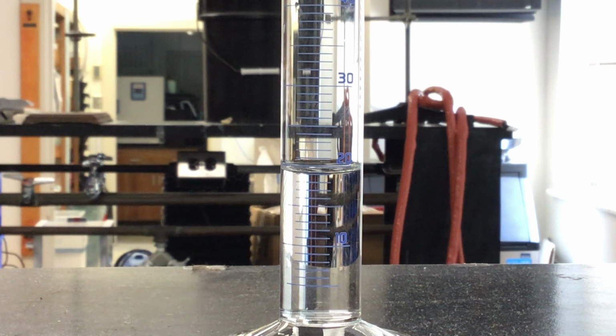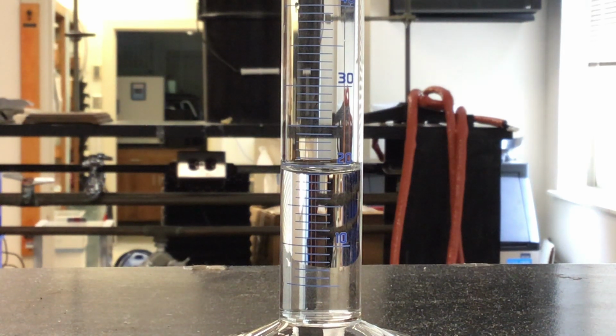It's kind of our uncertainty. So for me, I'm going to read this and say that maybe I think this is 18.9 milliliters as a volume. Someone else might read the same thing and say it's 19.1 or 19.0 milliliters. Those are all fine. That last decimal, we understand it's going to be kind of our best estimation. So there's going to be some variation in what different people might actually record that measurement as. But again, one decimal place further than the graduation marks is that habit we always want to be in when we're making these measurements.